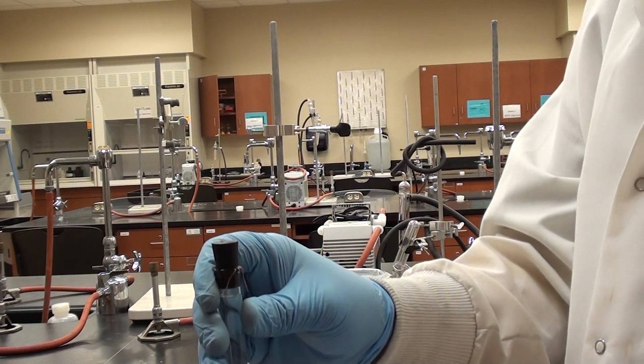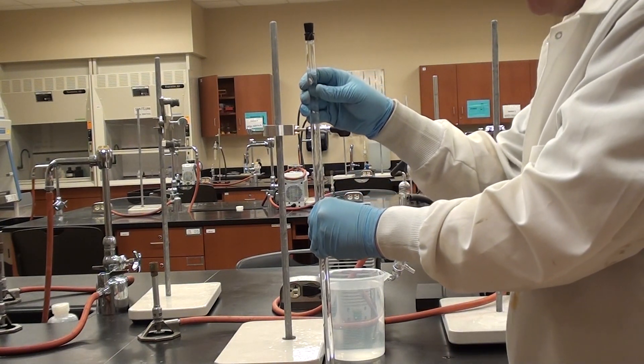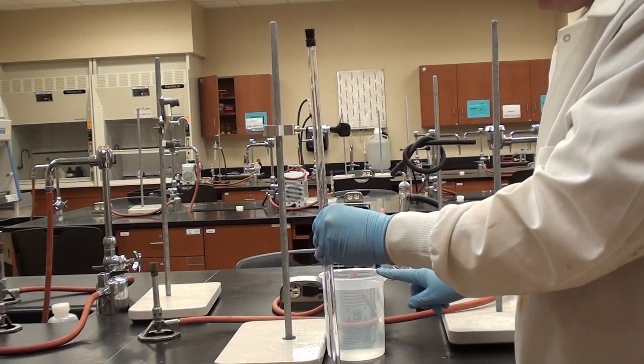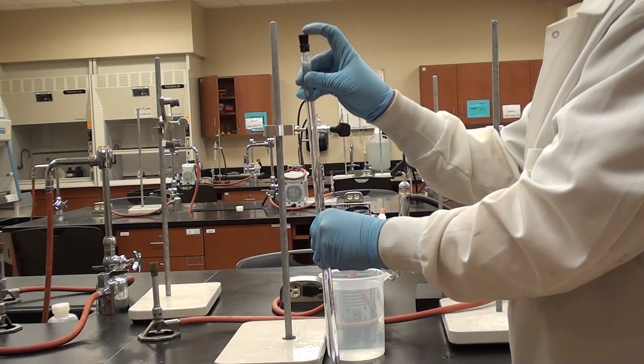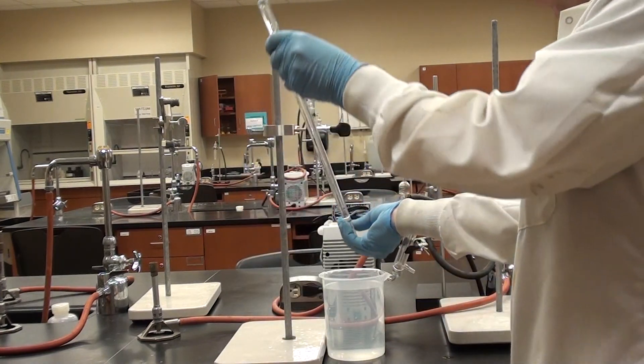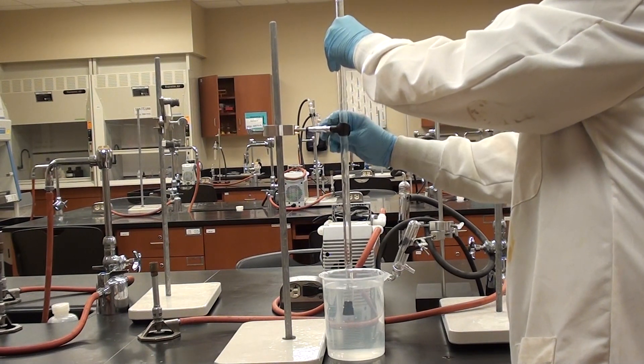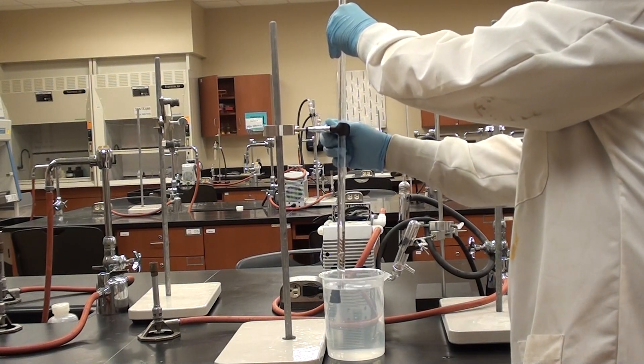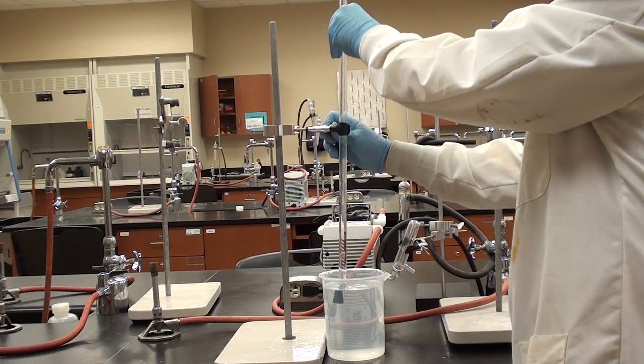What I'm going to do now is I'm going to take this over here and I'm going to flip this and then clamp it in here and put it under the level of the water in this beaker. I'm going to keep my finger on the stopper here, make sure it doesn't come out. And away we go. So the bottom of the eudiometer tube just has to be under the level of the water. I'm going to clamp it in there like that.